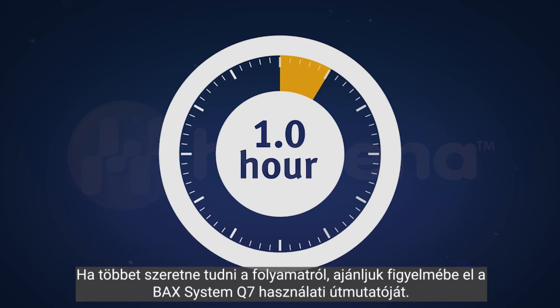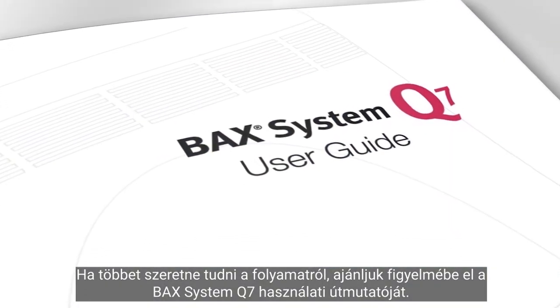To understand more about the process, refer to the BAX System Q7 user guide.